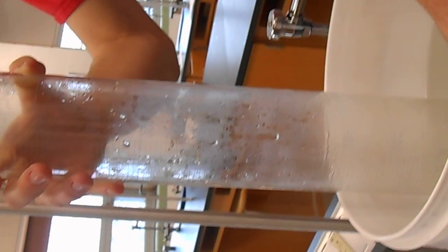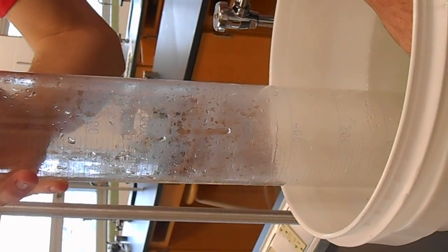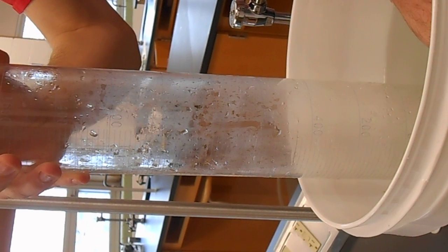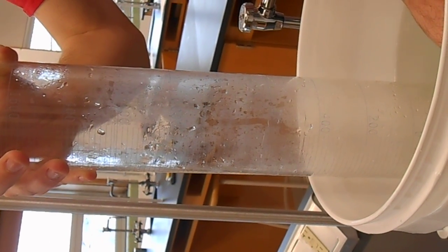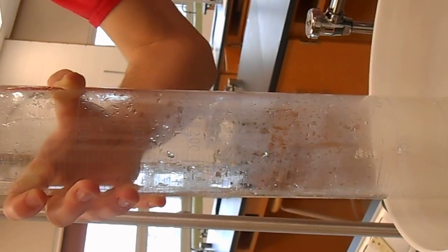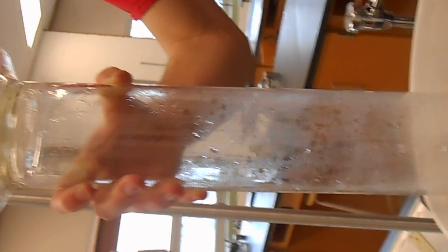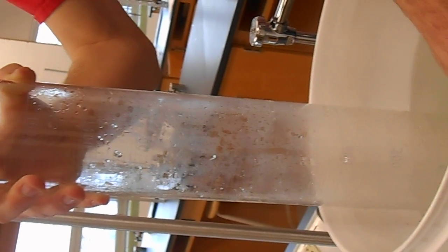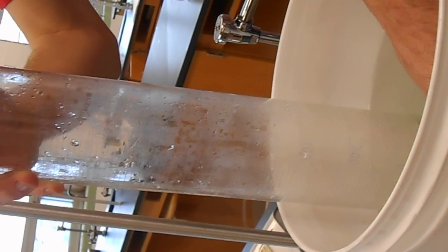We actually must have mis-measured just a little bit because we've produced slightly over 2,000 milliliters of gas, or 2 liters of gas. Congratulations, chemistry class. Give yourself a round of applause.